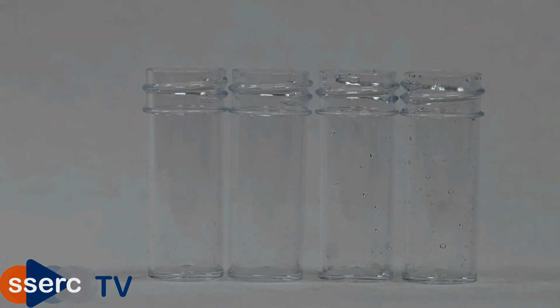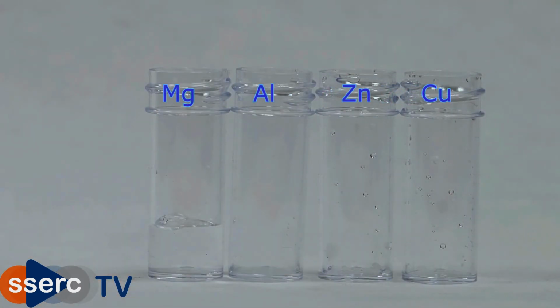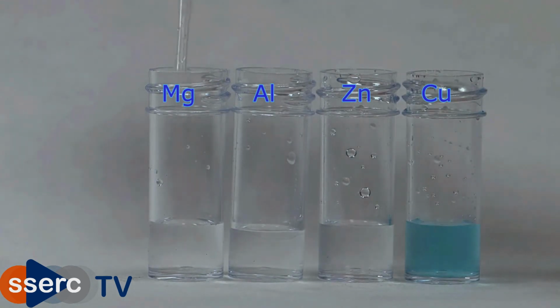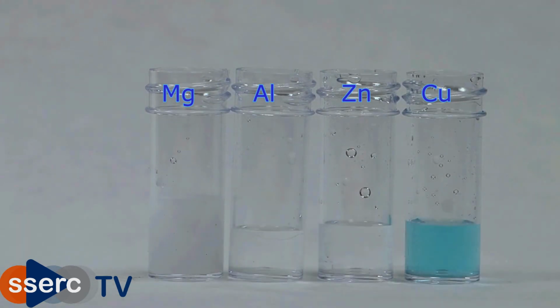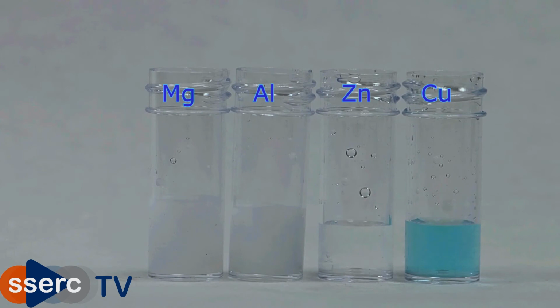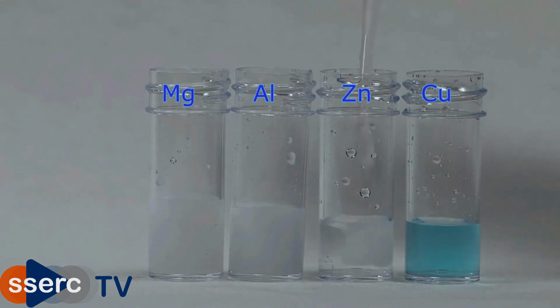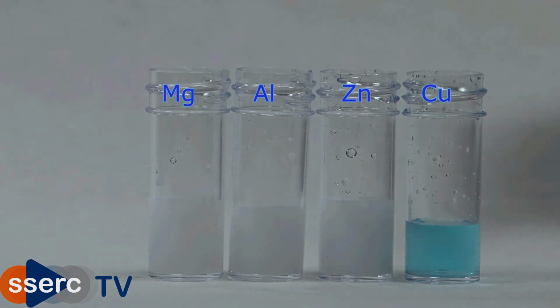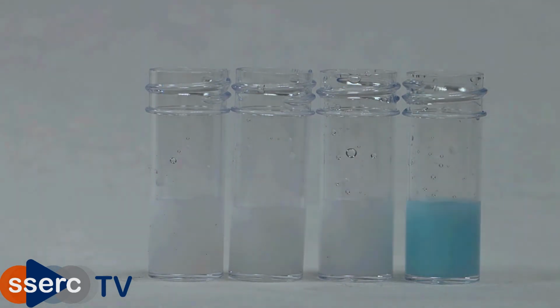And now for sulphates. Here we have, from the left, magnesium, aluminium, zinc and copper sulphates. And we test these by adding barium chloride solution. As you can see, a white precipitate of barium sulfate forms in each case. If you're going to do this test, you should do so after you've already got a negative test for carbonates. The carbonates too will give a white precipitate with barium chloride.